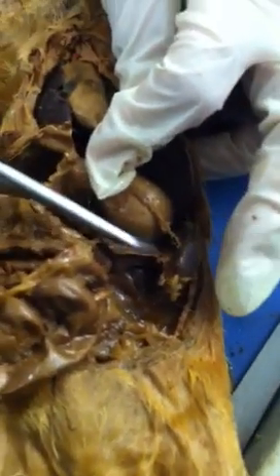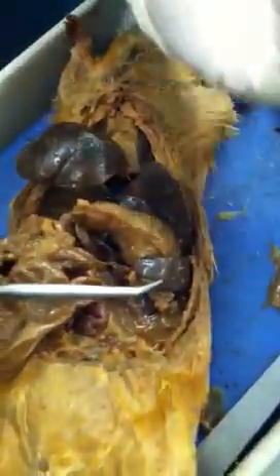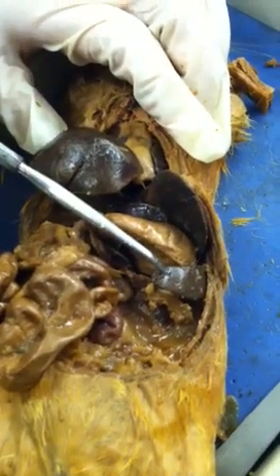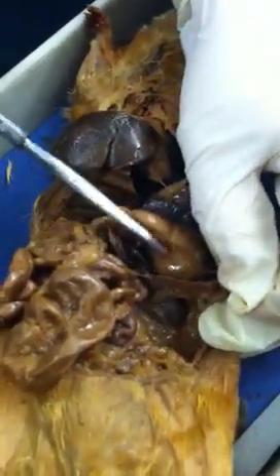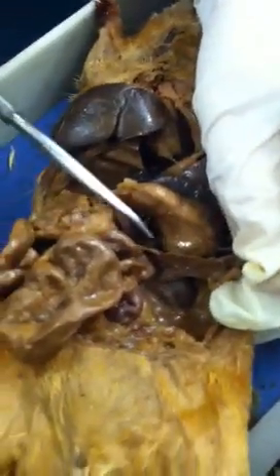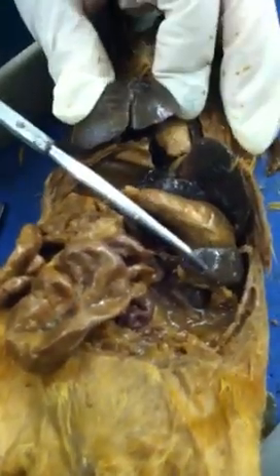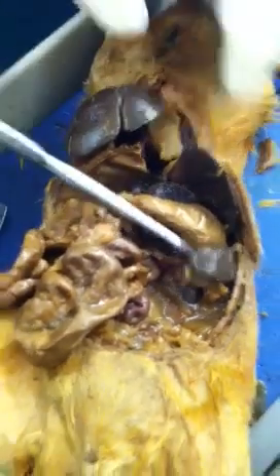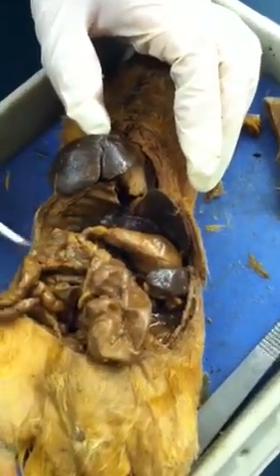Right next to the pancreas, you will see this colored organ. It's kind of similar to liver, but it originates from the back and is just on one side — that will be the spleen. Remember, the pancreas has a similar color to the stomach and intestine and is kind of like a piece of tissue, but the spleen is a confined organ with a color very similar to the liver, originating from the back.